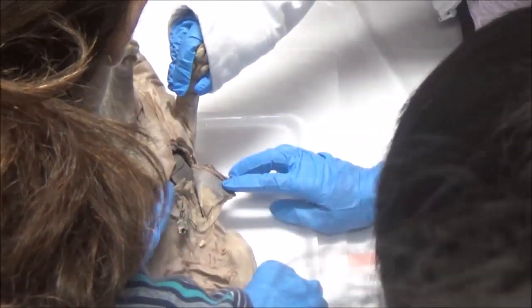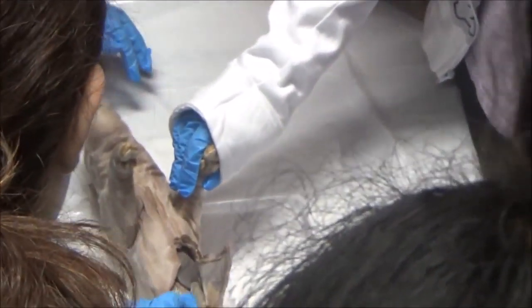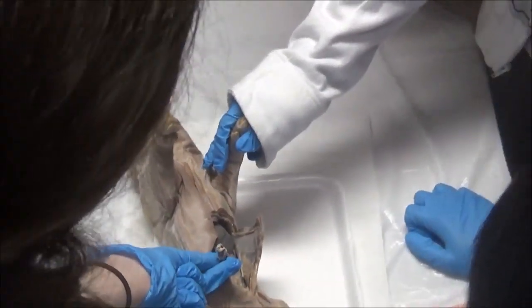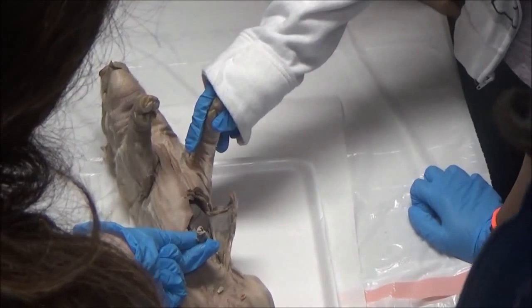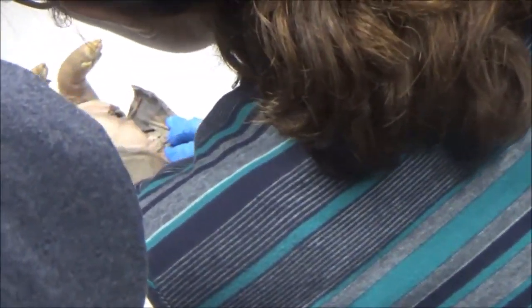I think they attached it as they were doing what they had to do to the pig. There's like a thing connecting. The umbilical, right, has arteries and veins in it to connect it to the placenta. So these are arteries and/or veins. I'm not getting a good clear picture, so I'm just going to cut them so we can get this out of our way.